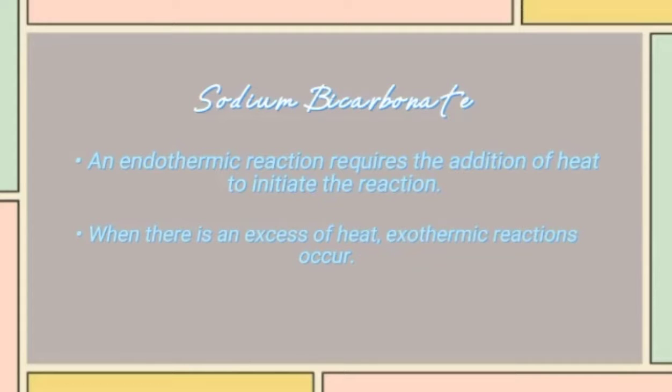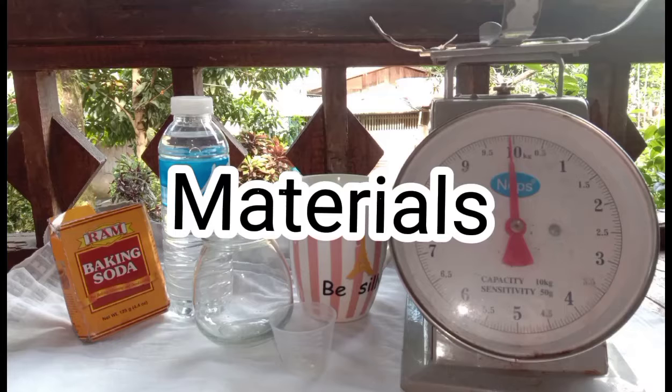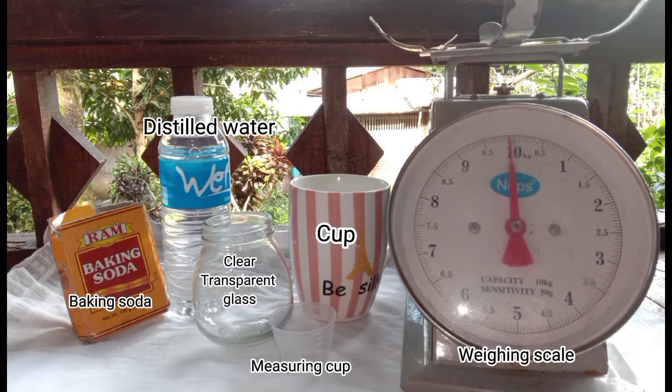The carbonic acid is no longer stable at this point. This is when the well-known fizziness enters the picture. Carbon dioxide is generated when baking soda combines with water, resulting in the iconic fizz. Now, let us begin our activity of drawing conclusions concerning the sodium bicarbonate solution without more delay. So, we have here the materials we use.